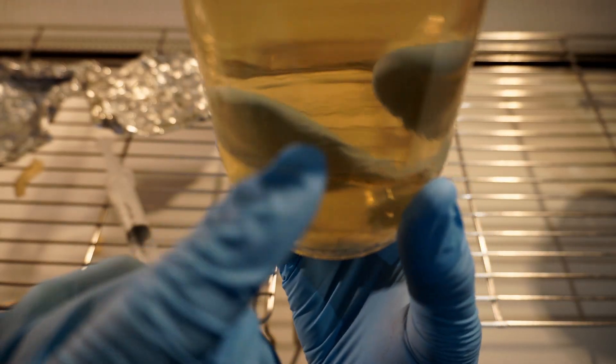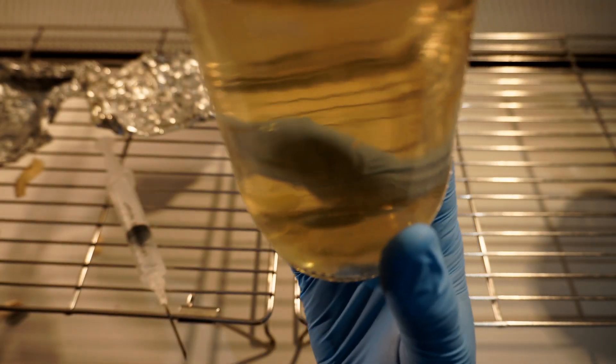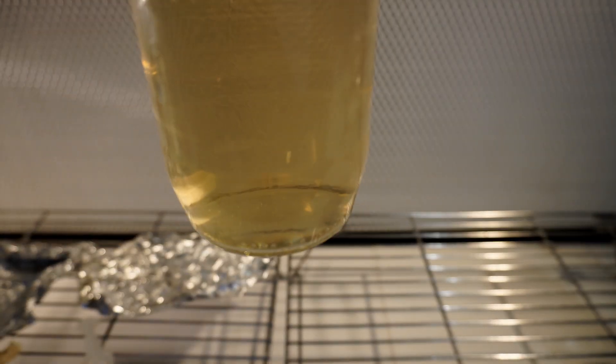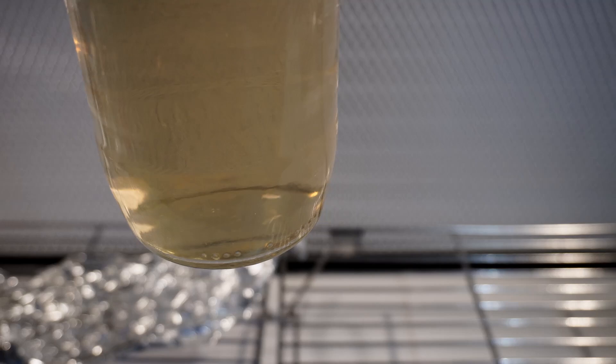In this video I'll show you how to clone a mushroom using needle biopsy. This method is simple and straightforward, making it ideal for beginners who want to create a liquid culture by cloning a mushroom. I'm also going to show you an additional method which I like to use towards the end of the video.